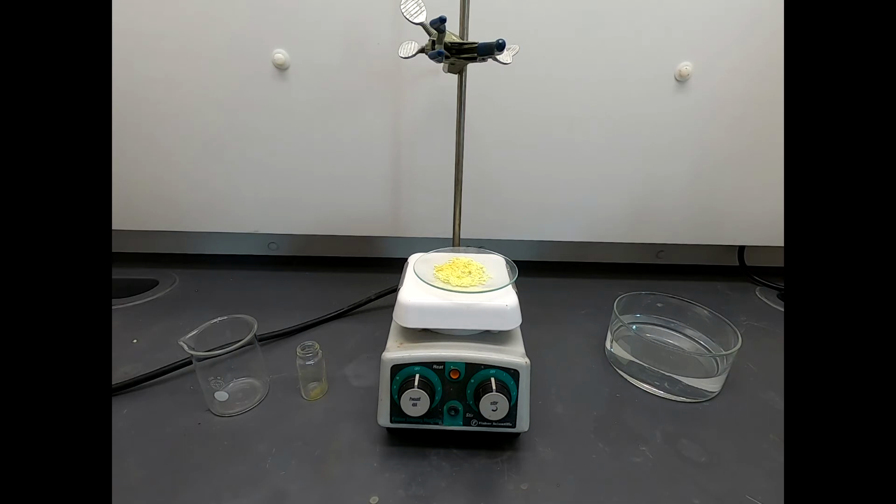So our final mass is 995 milligrams, so not quite 1 gram, but pretty close, 995 milligrams. And so this looks like nice material. Now it's just a matter of, let's see how nice it is. Let's do some characterization. Get a melting point, a TLC, an NMR, and see if this is actually clean material, and determine what our final yield of our product is.